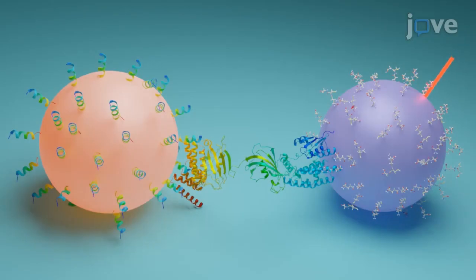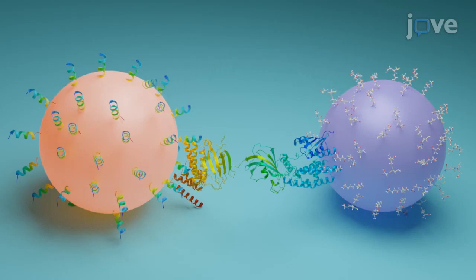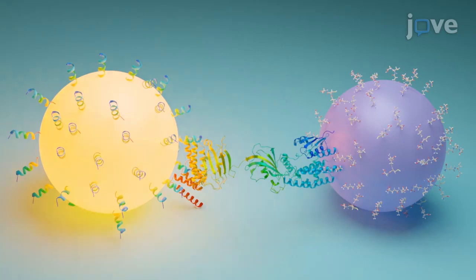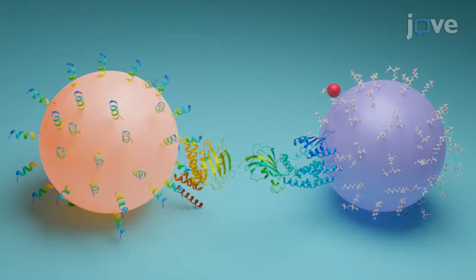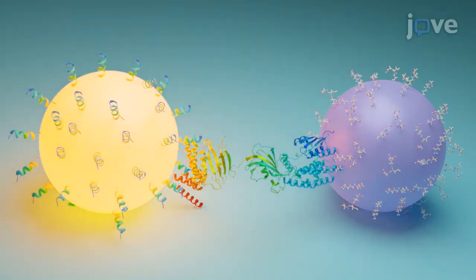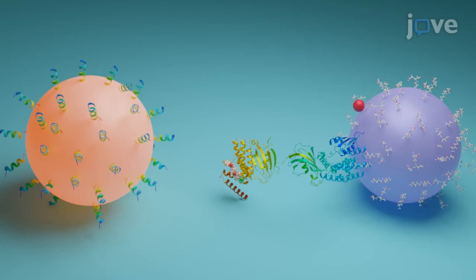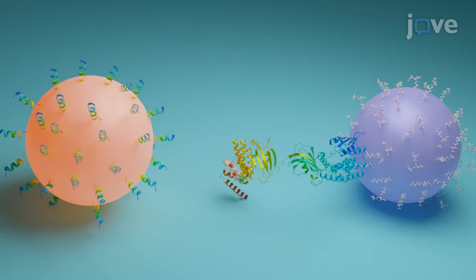Here is the basic principle of this assay. When the interaction between the Hsp90 C-terminal peptide and the TPR domain of cochaperones brings the donor and acceptor beads into proximity, a highly amplified signal is generated. When interaction inhibitors are added, the donor and acceptor beads cannot reach proximity, and no detectable signal is produced.